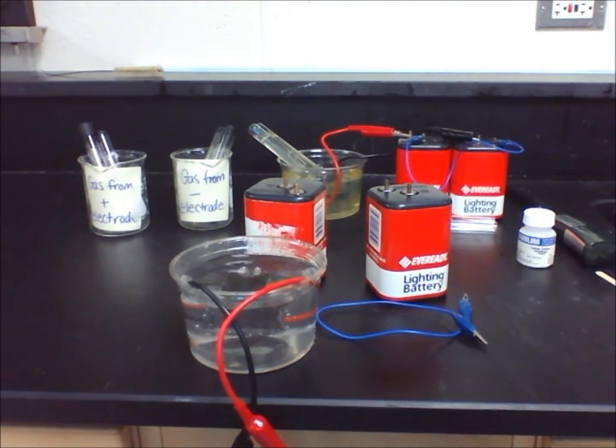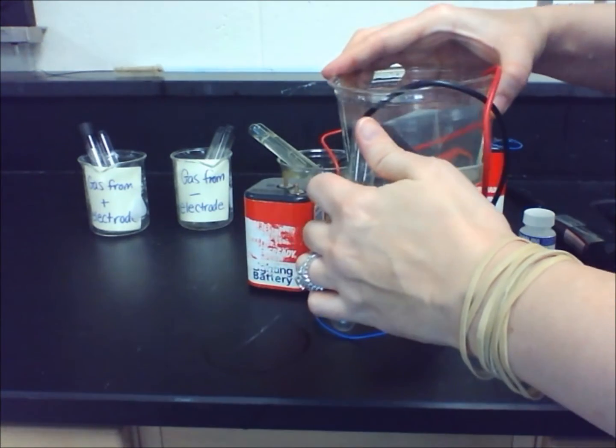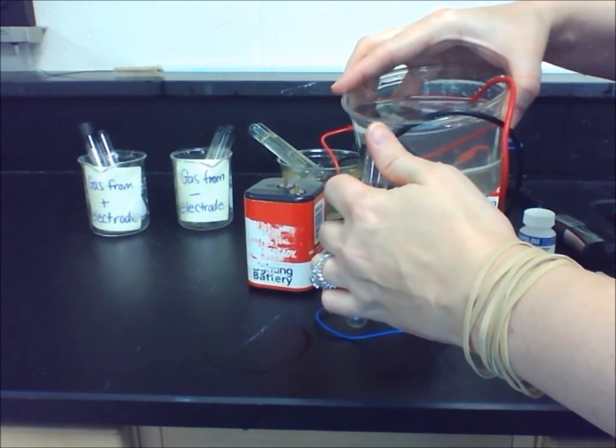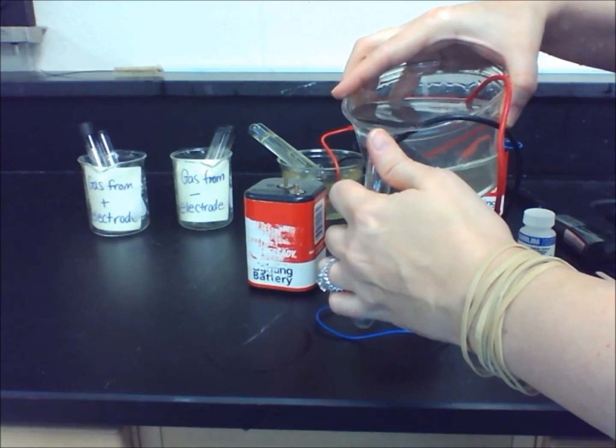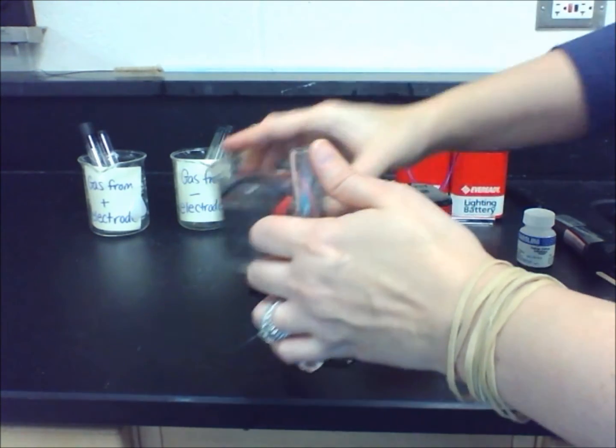Your teacher will come and add two scoops of sodium sulfate to the water. This will help conduct the electricity. Stir the solution with a plastic spoon.